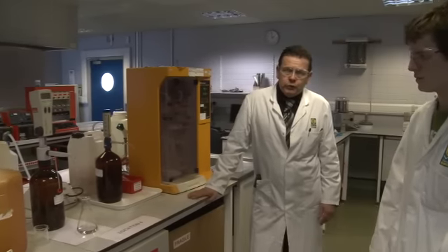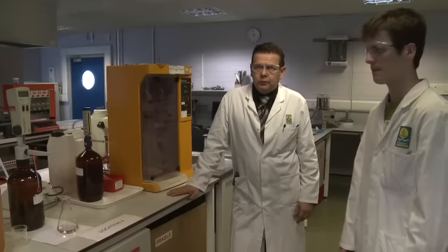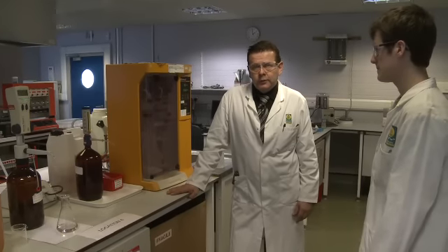That can now be used to calculate the nitrogen content of the sample, and from that directly the protein content of the sample. The principles and techniques here of weighing, loss on drying, extraction, reduction, fat extraction are equally applicable to many other consumer products, both food and non-food materials.